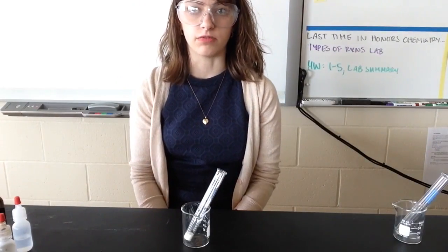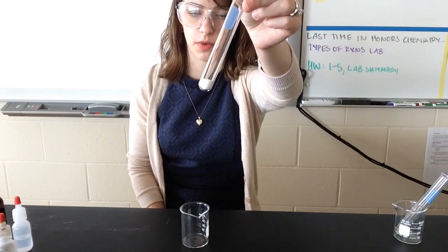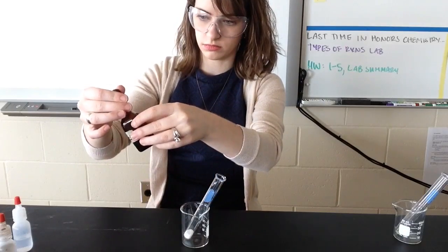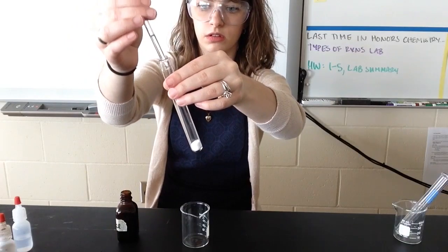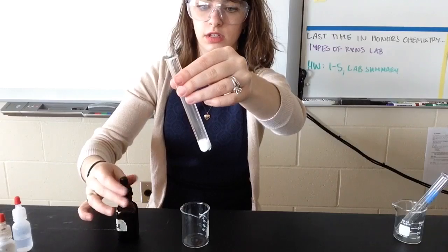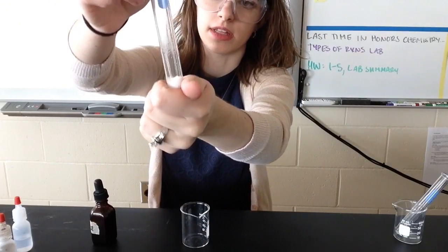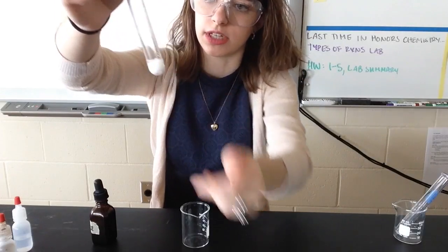In the second part of part 4, I'm going to mix my solid sodium carbonate, that's the white powder in the test tube, with some 3 molar hydrochloric acid. So I'm going to add the acid to my test tube. And it got all fizzy. And I could hear it, I don't know if you can. And if I feel the bottom of that is very warm. So I saw it get fizzy, and the bottom's warm, and you could even hear it bubbling.